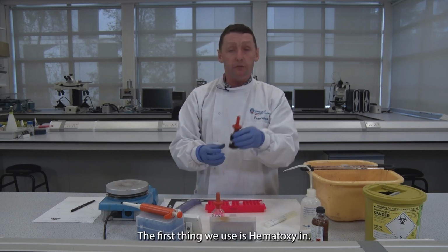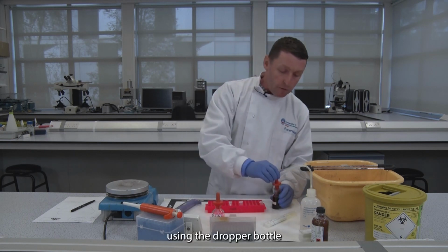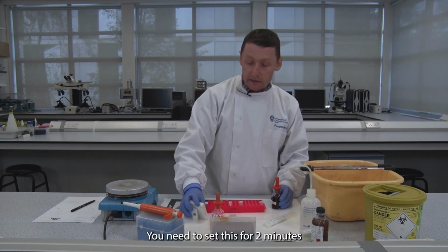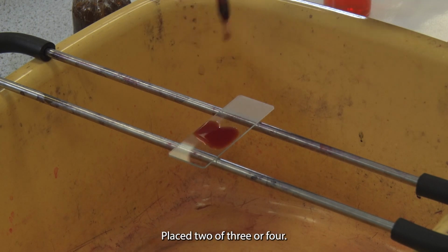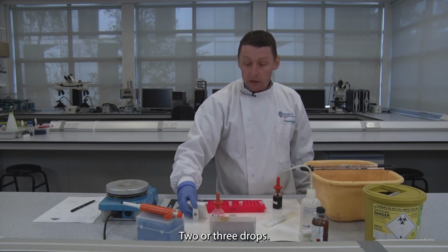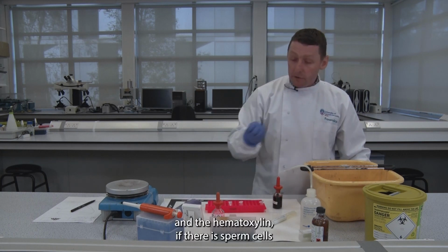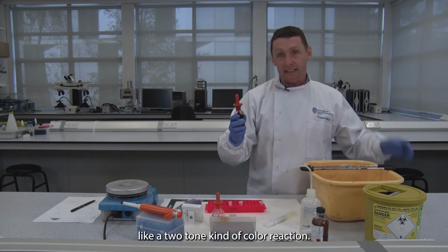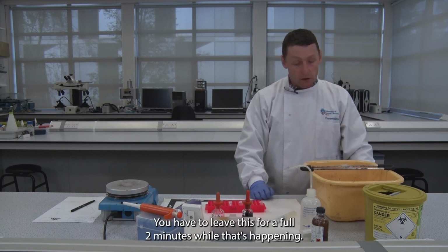The first stain we use is hematoxylin, the purple looking stain here. Using the dropper bottle and having a stopwatch quite close to you, you need to set this for 2 minutes. Place 2 or 3 or 4 drops, there's no set quantity. Set your timer for 2 minutes, and the hematoxylin, if there are sperm cells present, stains the sperm head in a two-tone kind of colour reaction. You have to leave this for a full 2 minutes.